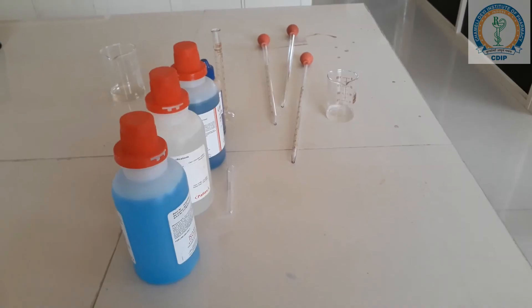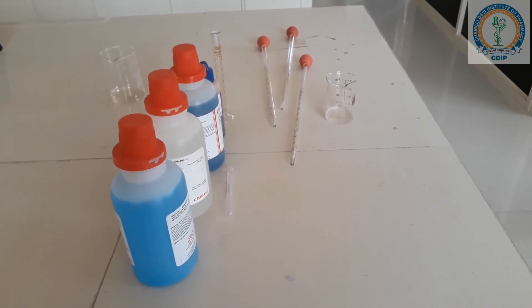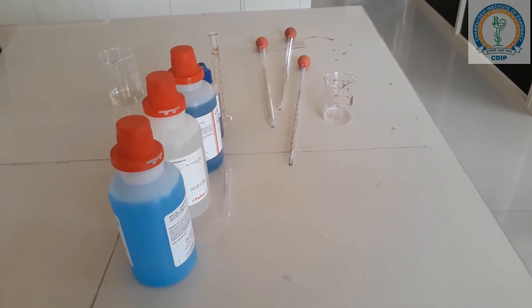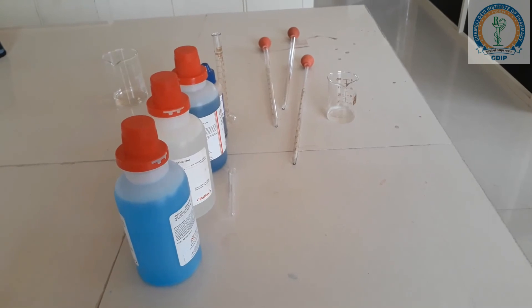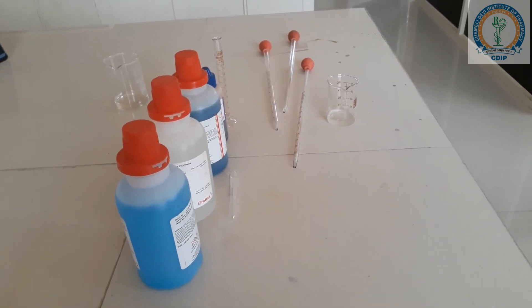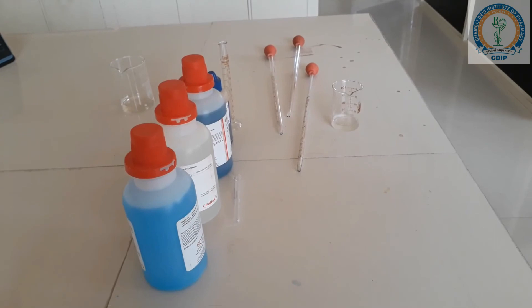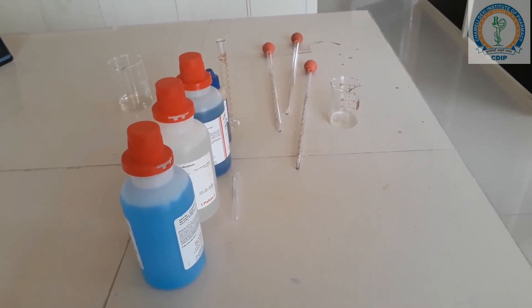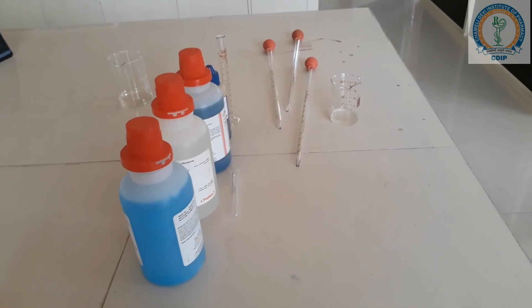The principle of this test is: if the carbohydrate has a reducing group, the cupric ions present in the Fehling's reagent will be reduced to cuprous ions and even copper, and this will produce a rusty brown or red precipitate.